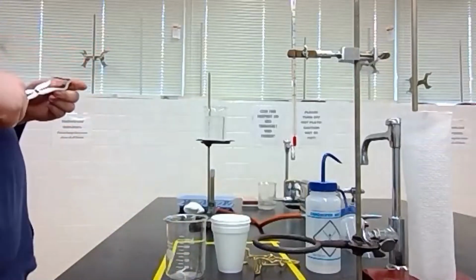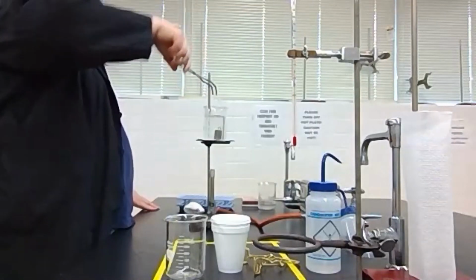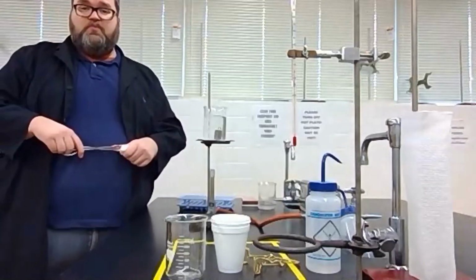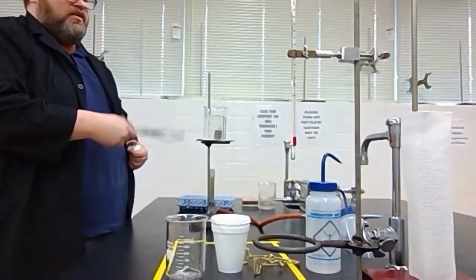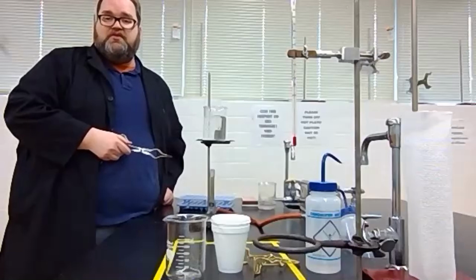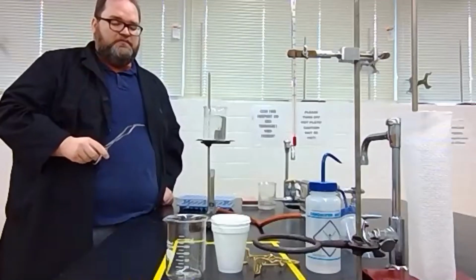Since that water is boiling, and boiling water is always 100 degrees Celsius, the highest temperature that our metal can reach is 100 degrees Celsius. So if we allow this water to come to a boil, and then we give that metal enough time, it will also be 100 degrees Celsius. We can use that as the initial temperature of the metal.